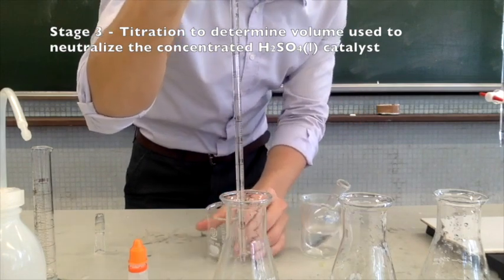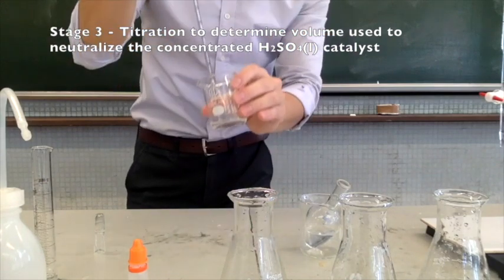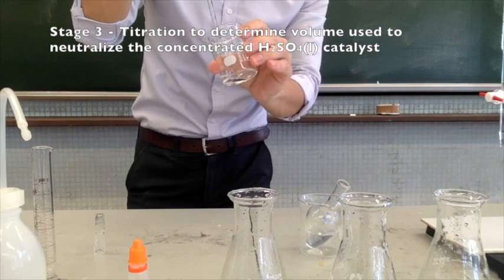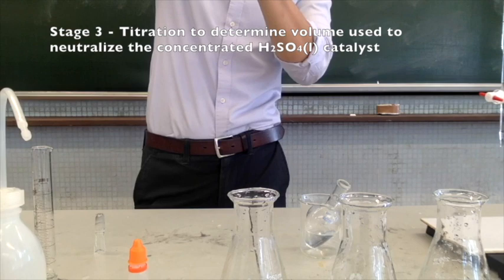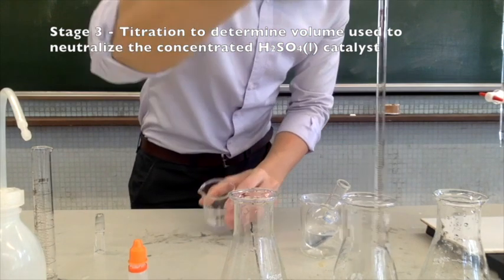Now, adding the mixture into the water will significantly dilute the concentrated sulfuric acid and therefore prevent the reaction from going too fast. So that's why we need to do this step as quickly as possible if you want to get a more reliable result.